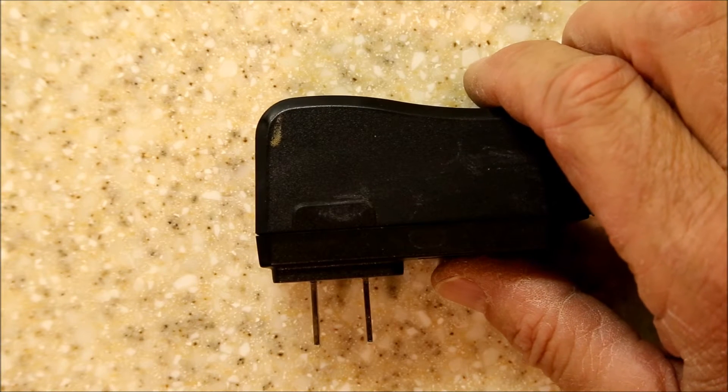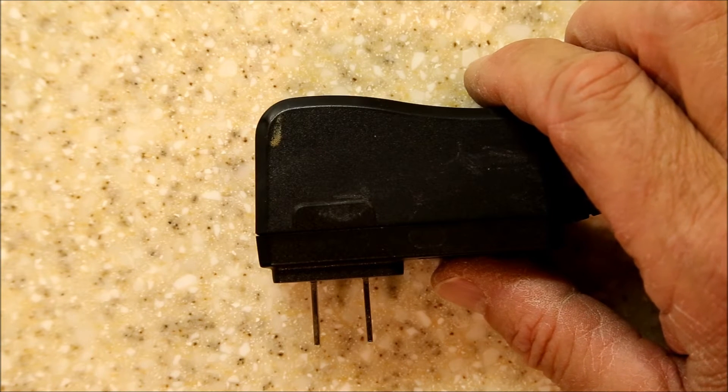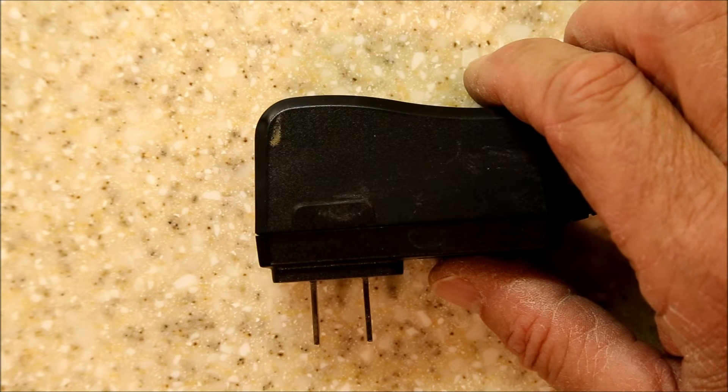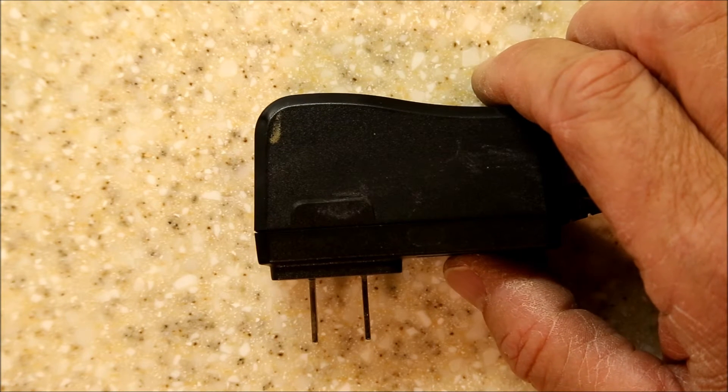I tried several combinations of different types of batteries, and they never worked very well for me. I couldn't get enough current to get the crystals to grow fast enough to be interesting.